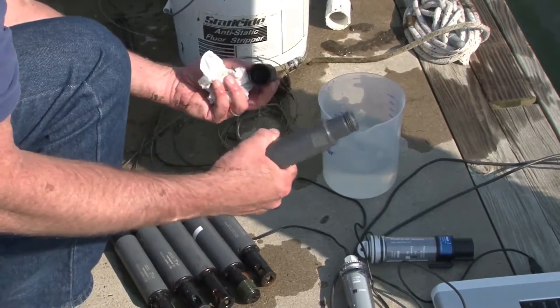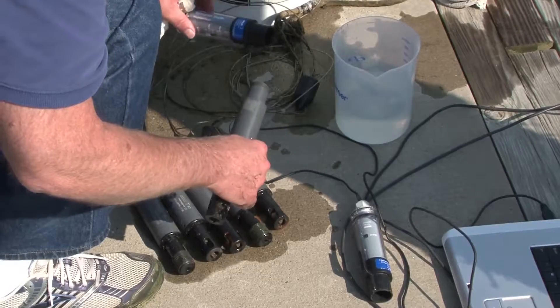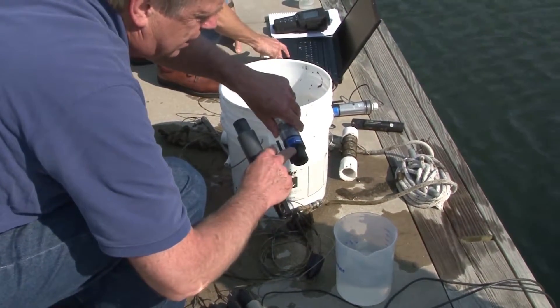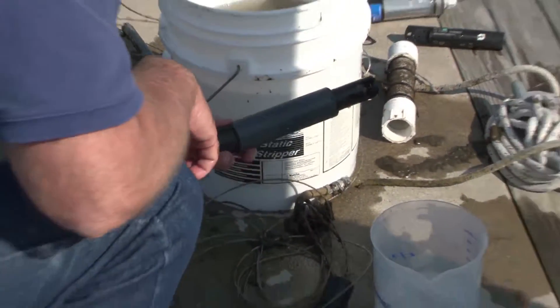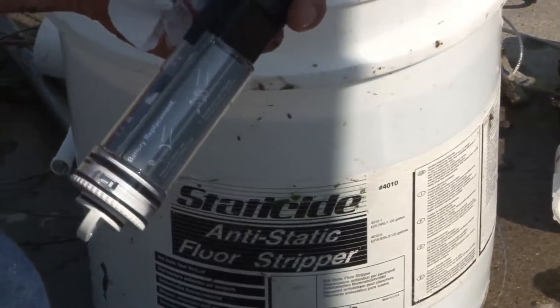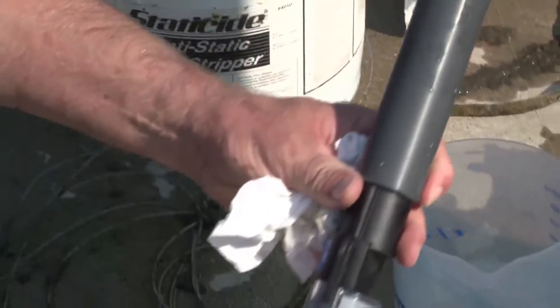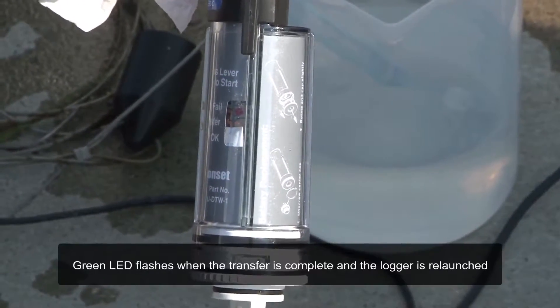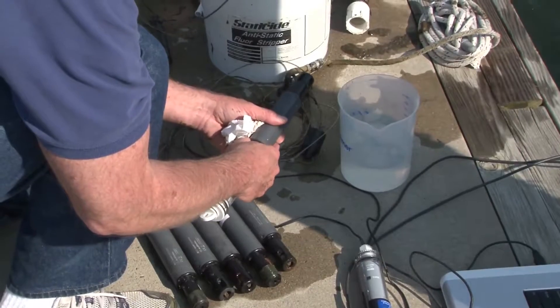We're now going to remove the cover for the computer interface — the coupler. In this case, we're going to use a waterproof shuttle. You attach the waterproof shuttle to the coupler, aligning the line on the coupler with the line on the logger, and you press the lever to start. The transfer light comes on and it transfers data into the shuttle. You can see the transfer light flashing. I think it's done — we remove it.